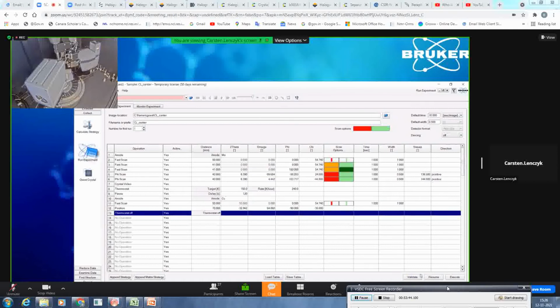Don't worry if you haven't validated yet. If you click execute, it will do it anyway. So this is internally implemented in the execute as well. And it will give you direct feedback if there is a problem. For example, what you have programmed in line 4 is not valid. With that, you would click now execute.